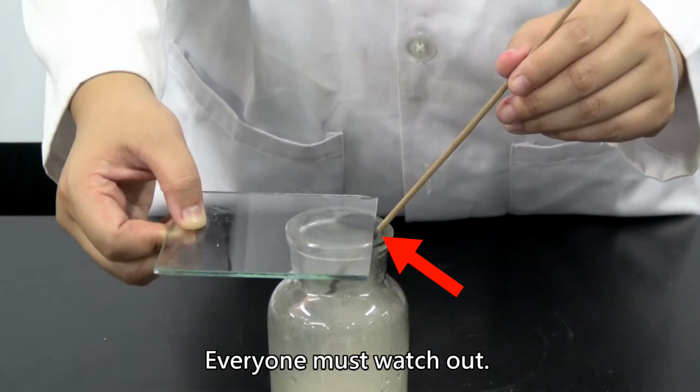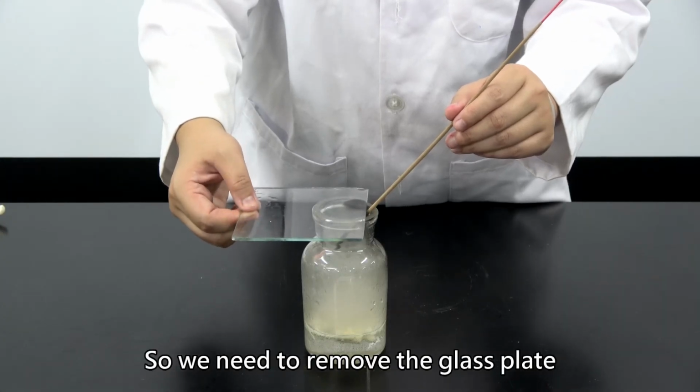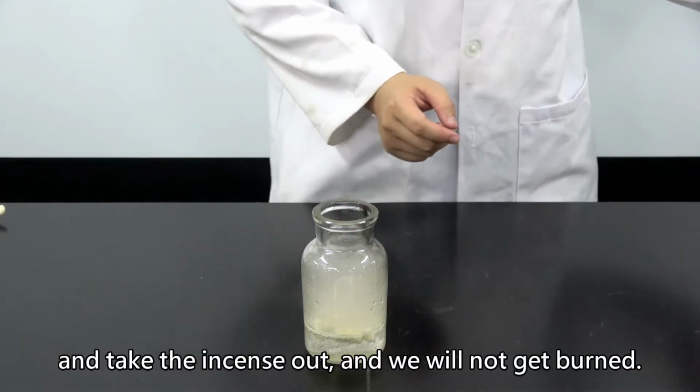Everyone must watch out. The blackened places will be hot. So we need to remove the glass plate and take the incense out, and we will not get burned.